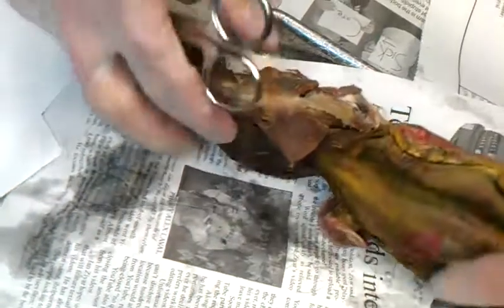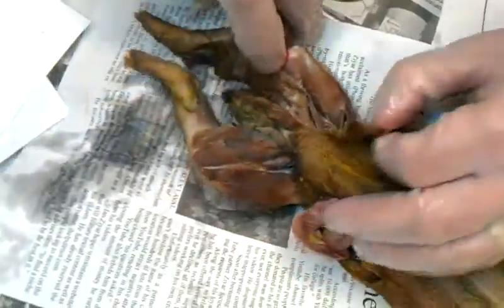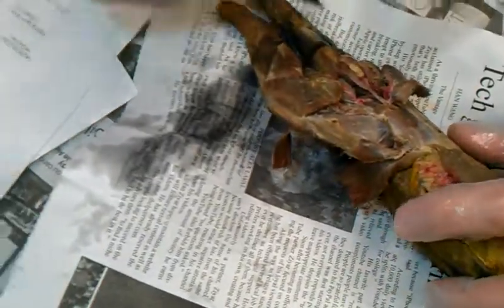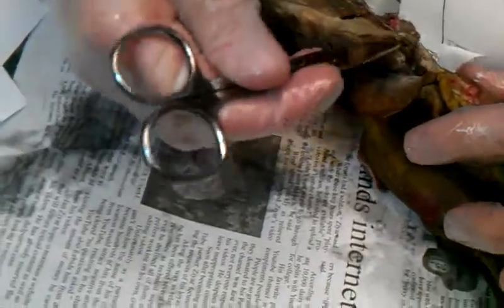You see that spot? But you did not do that. So I don't know what that is. Was that a five-point penalty? What did you decide? 50,000-point penalty? Just have their grade — automatic fail? Good thing they're not mink doctors.